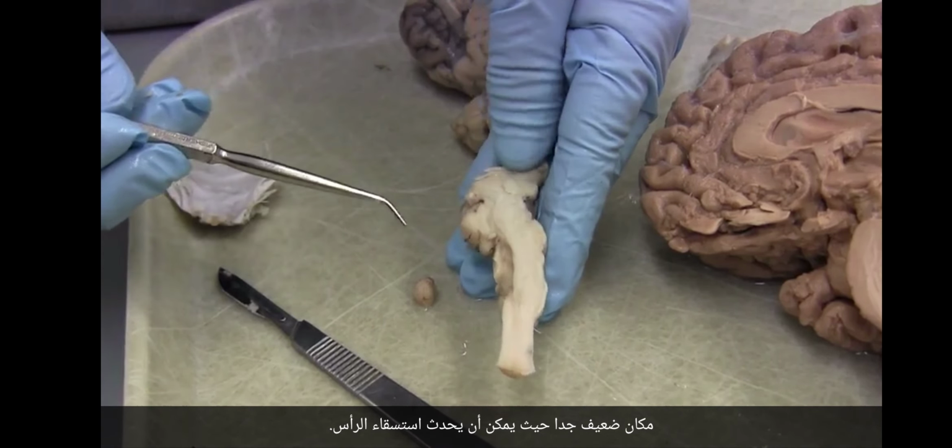Look at that. We're going back to the occipital pole. So there it is. The frontal pole, back through the body, back to the occipital pole, back here, and then it takes a turn and it goes down in there.